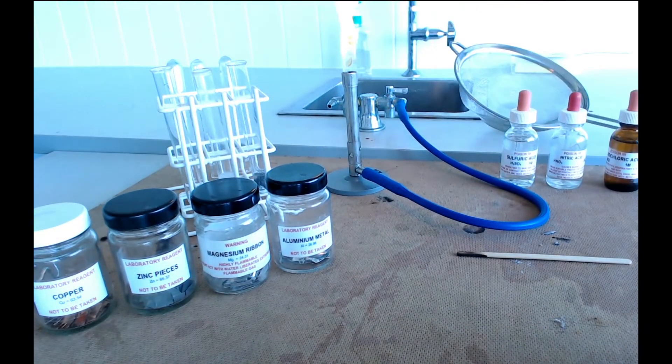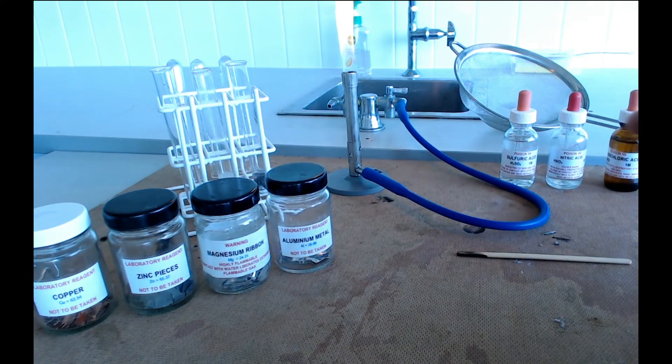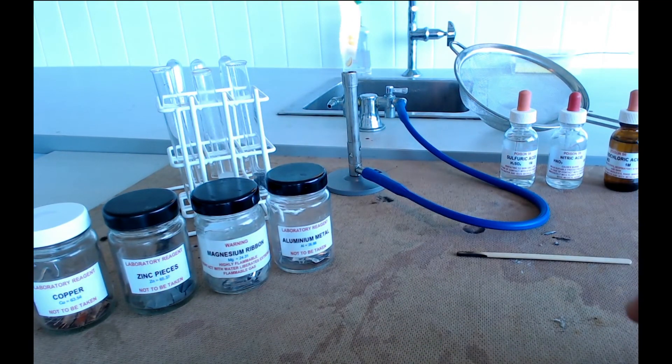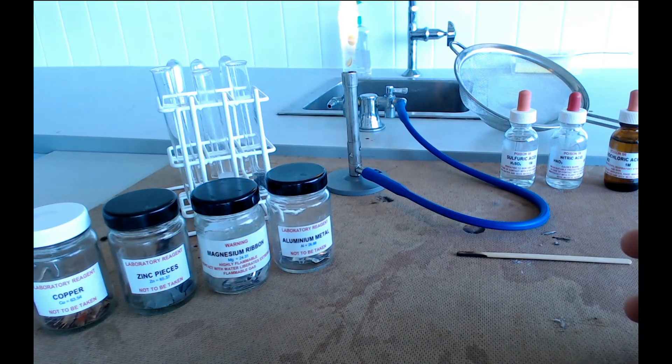Now your aim here today is to try and test every one of the five metals with every one of the three acids and see if you notice any patterns in the reactions. So do they react in similar ways or are some metals different to others?